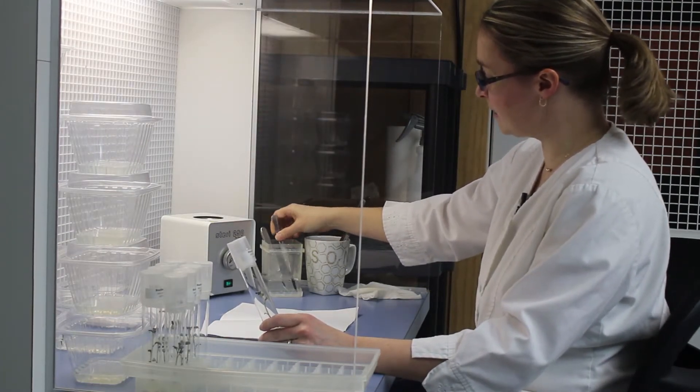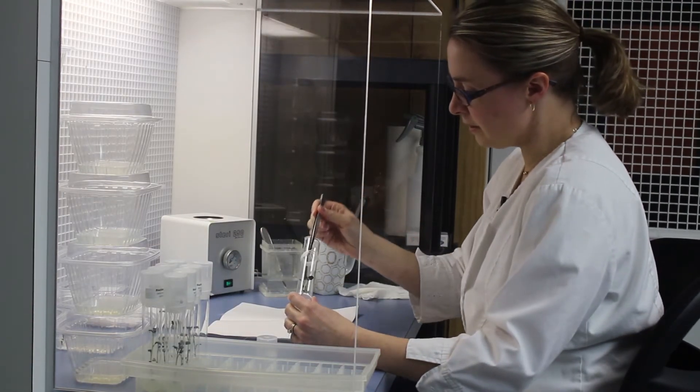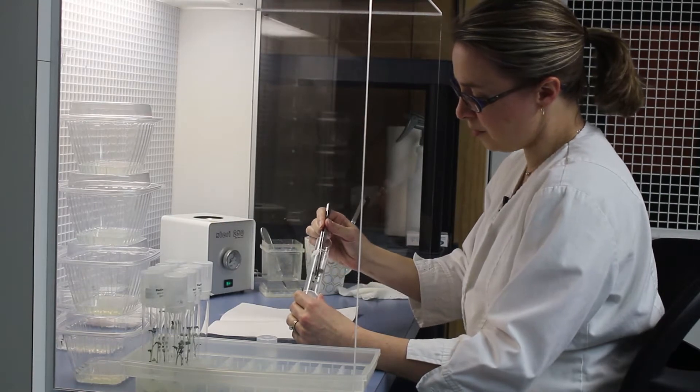So I'll cool off my utensils so I don't scald the plant. Gently reach in and pull it out of the gel.